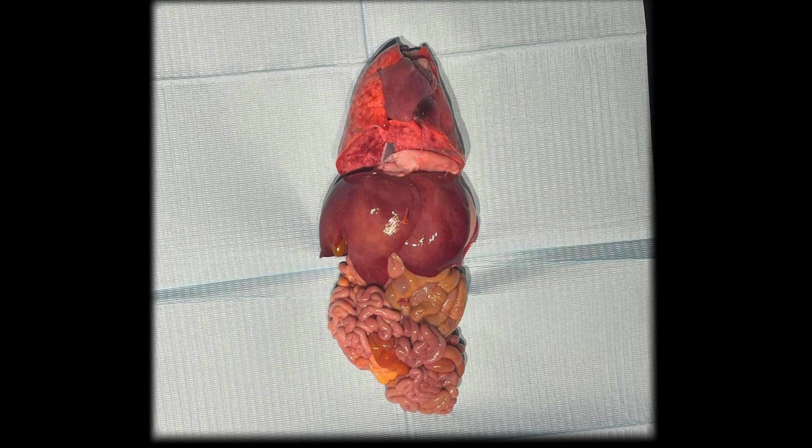Okay, we will now proceed to the abdominal cavity. As I have said a while ago, now I will be showing you the anterior view of the 9 regions showing the superficial organs. Please note that the organ placements I will mention are the organ placements of humans, not pigs. But it is worth mentioning that most of the organs found in the abdominal cavity of pigs are also in humans since they are both mammals.